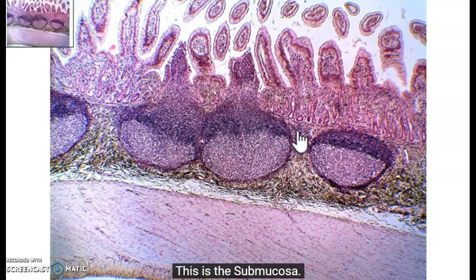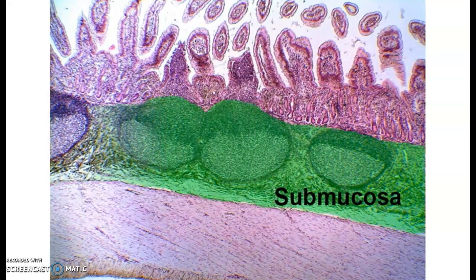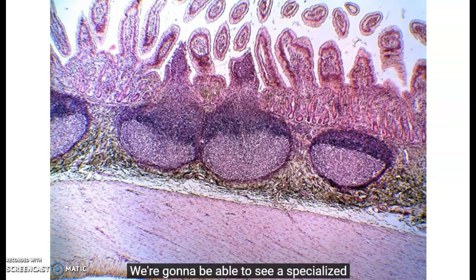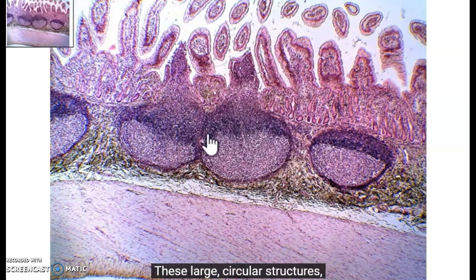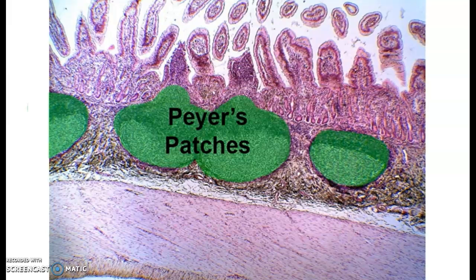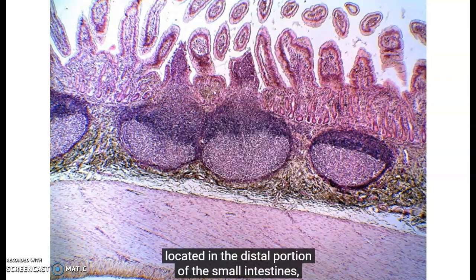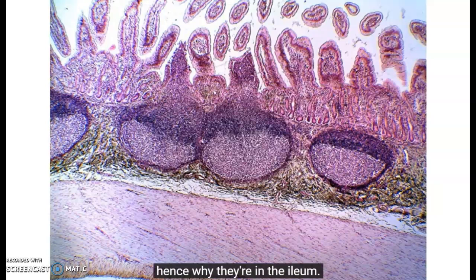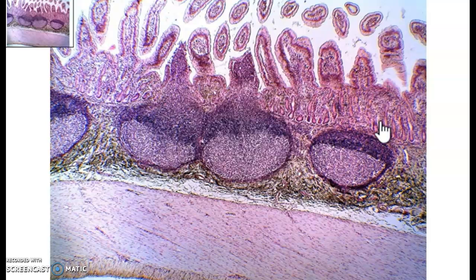Then we come up to the submucosa, which is the layer with the patches, and you're going to see as well these large and circular structures. They are the Peyer's patches. This is going to be lymphatic tissue to help us with immunity, and they are located in the distal portion of the small intestine. They're in the ileum, and then you have the mucosa.